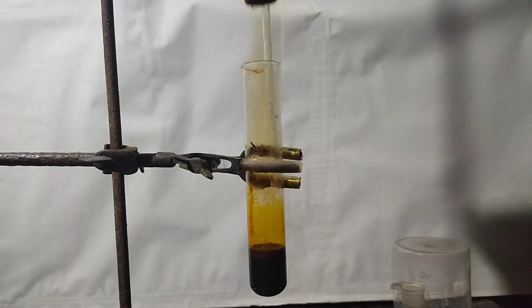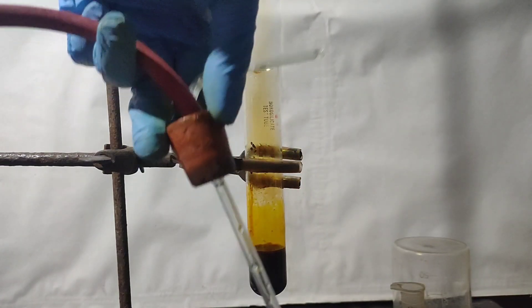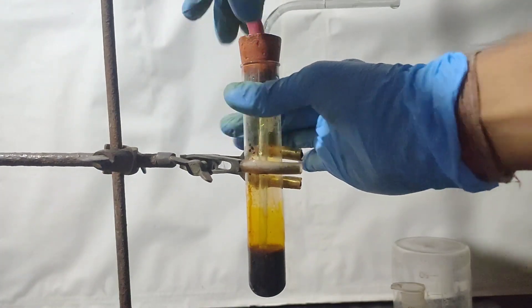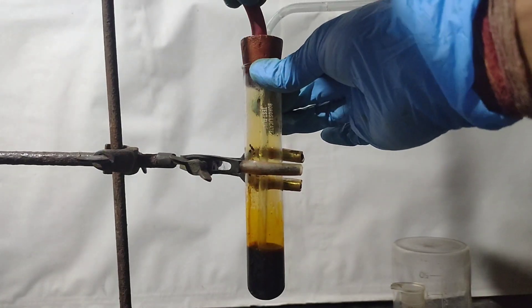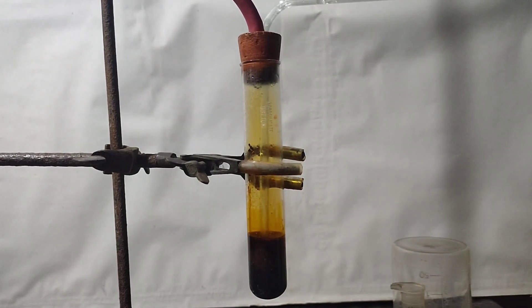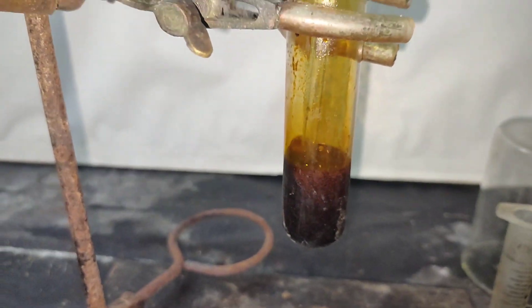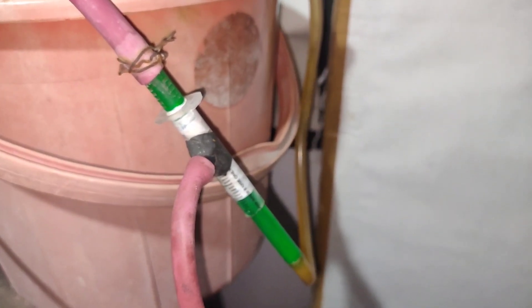I placed a rubber cork having two tubes - one tube to pass air through and one tube to suck air from it. The tubing is connected to a water aspirator which sucks air. In this way, air is bubbled from the second tubing into the solution. This is done to drive out the nitric oxide from the solution. I've already made a video on how to make this DIY water aspirator.